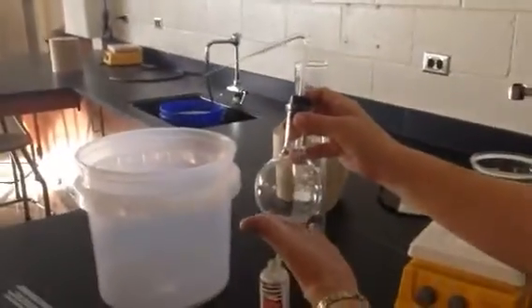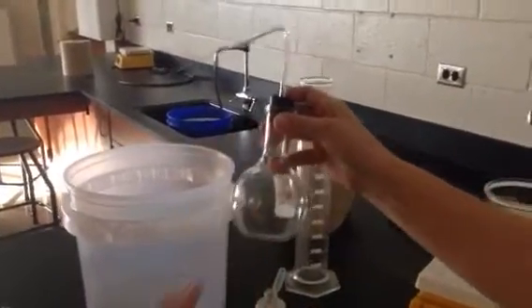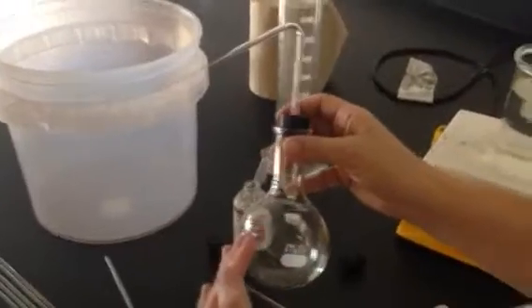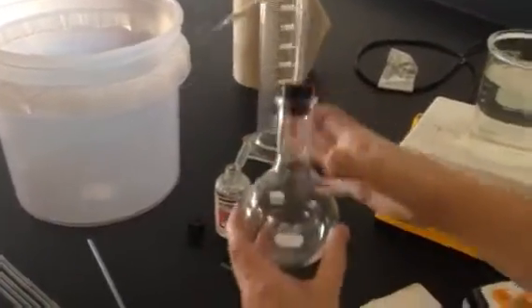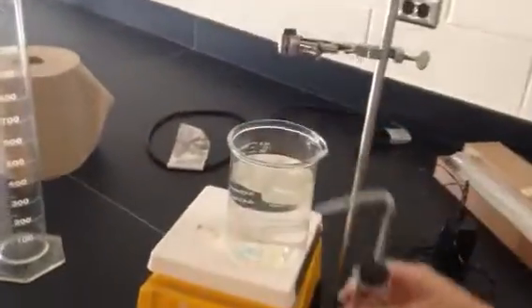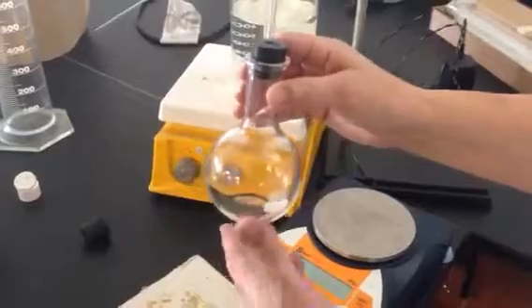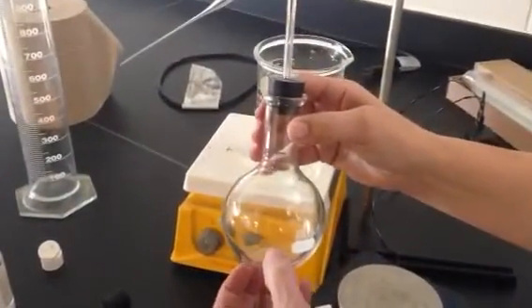This is a Florence flask. We use it with gases because they could explode against the flat edges of Erlenmeyer flasks. So this is a good thing to work with when you're working with gases. You're going to take this whole apparatus and weigh it, and then weigh it at the end once you've sealed this, and there's a little bit of volatile liquid in there.